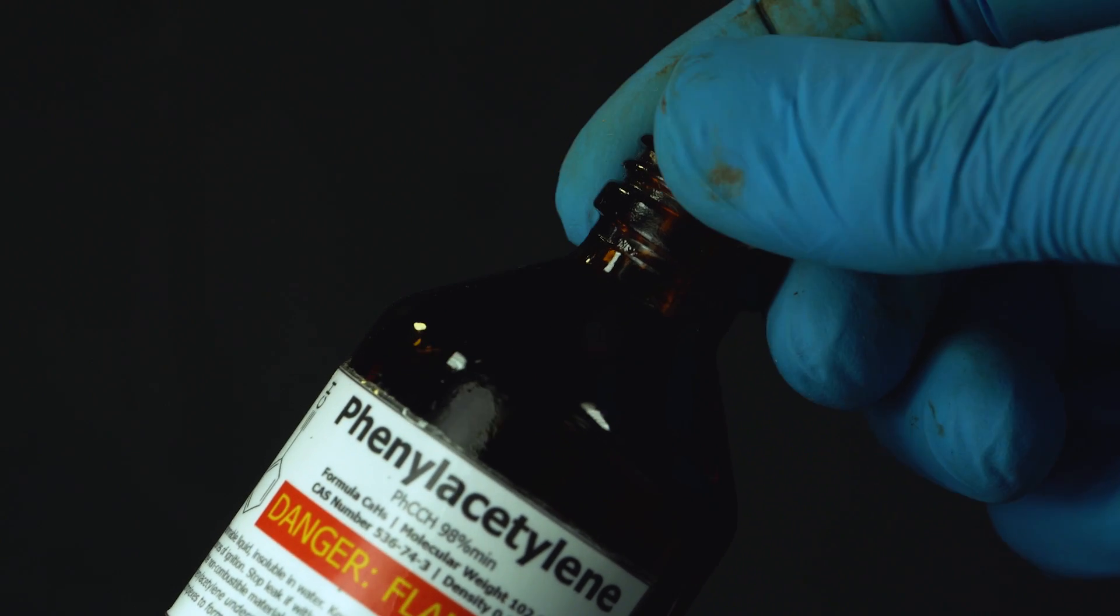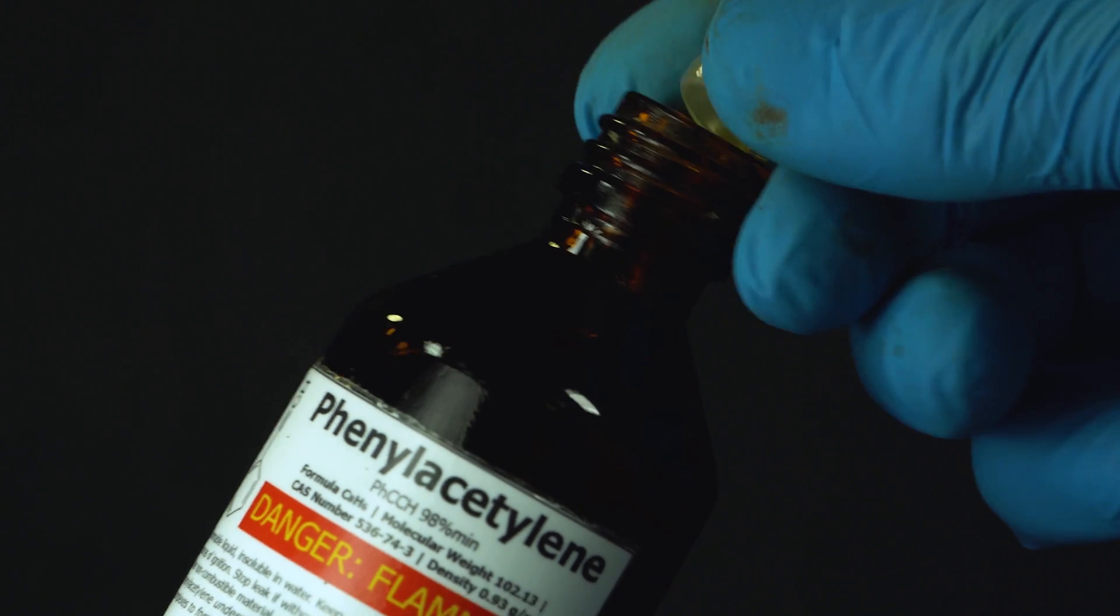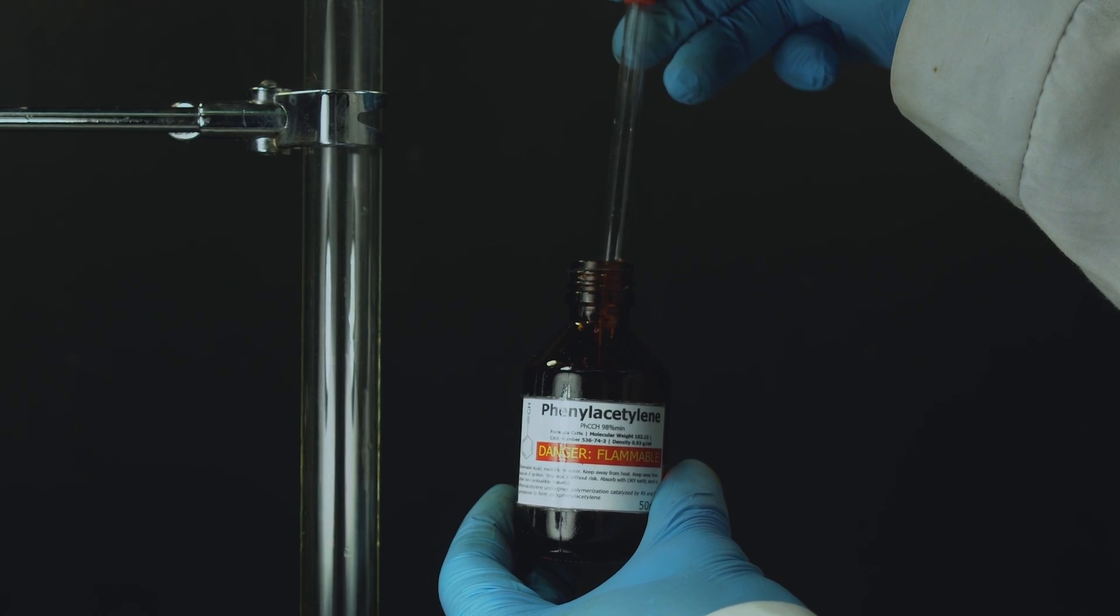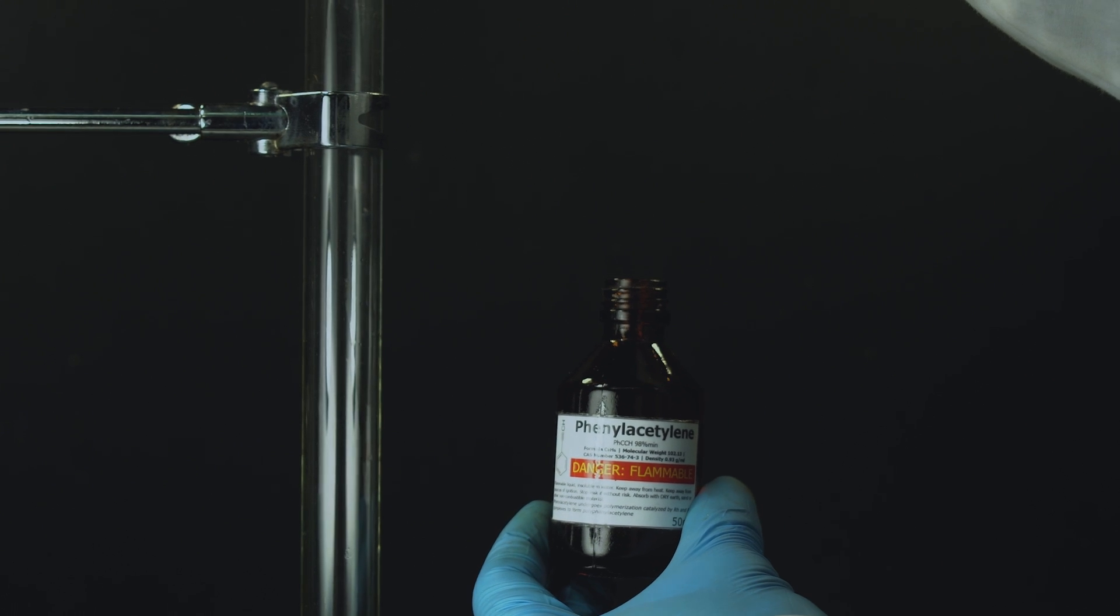In my next reaction, I used a way more reactive phenylacetylene. Phenylacetylene has a smell stronger than that of styrene. The color varies from colorless to yellow.